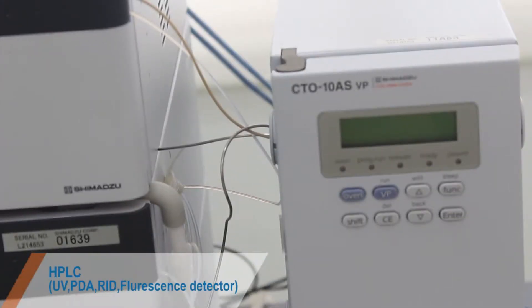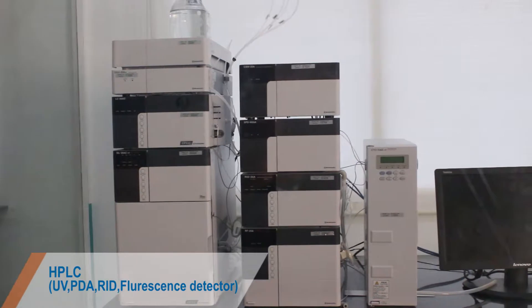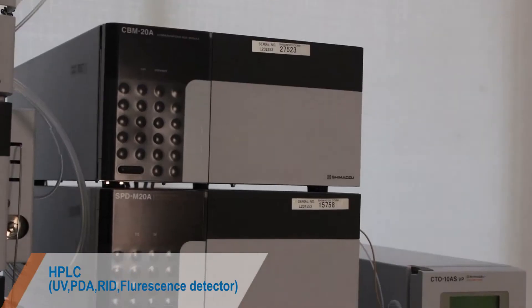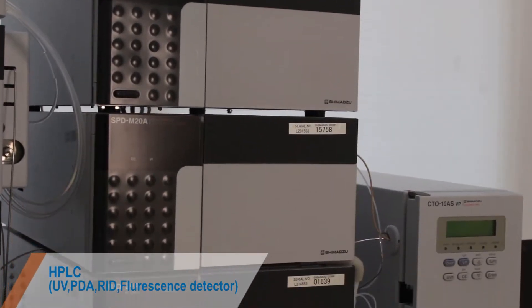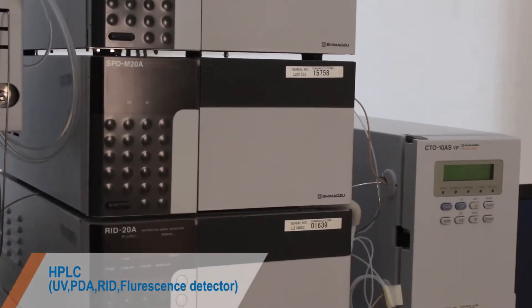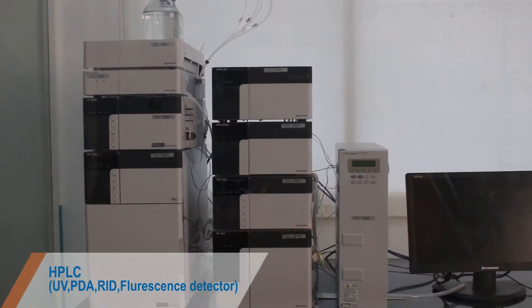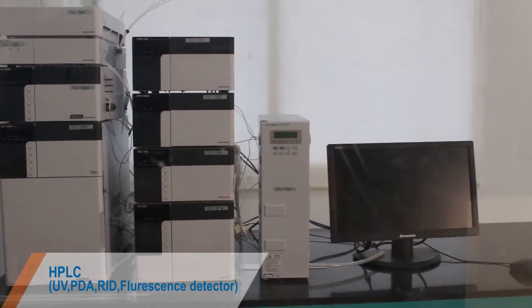HPLC is the chromatography separation technique for quantitative and qualitative estimation of components, widely used for analysis of life sciences, food industry, environmental monitoring and testing, leachables and extractables, etc.